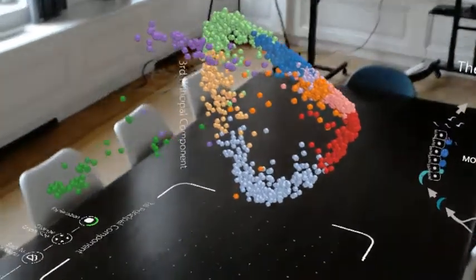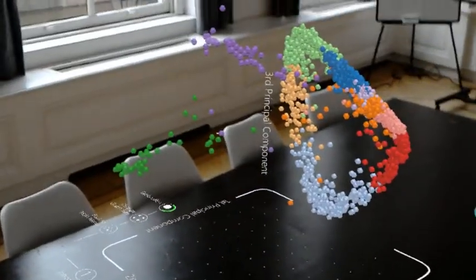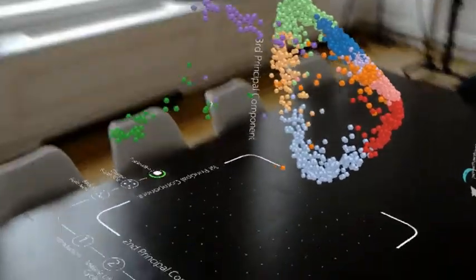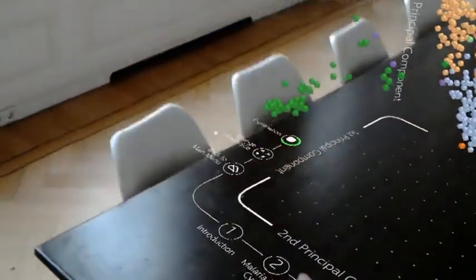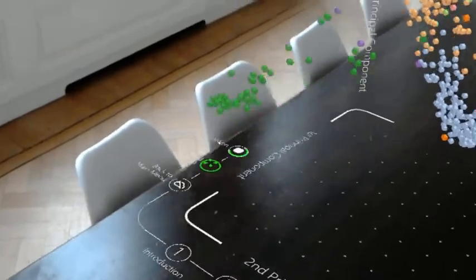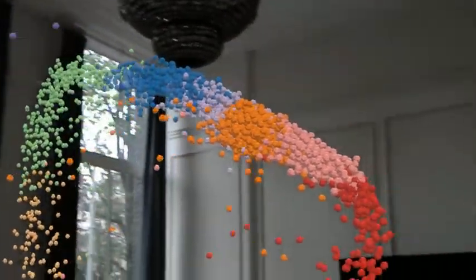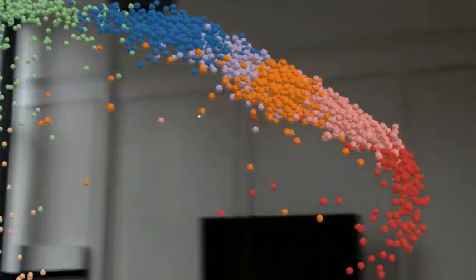And how this is used is we could have multiple HoloLenses. And we could discuss this data set as if it were tangible objects in the real world. And we can easily enlarge this data set so that we can inspect the data points closer and better see these different outliers.